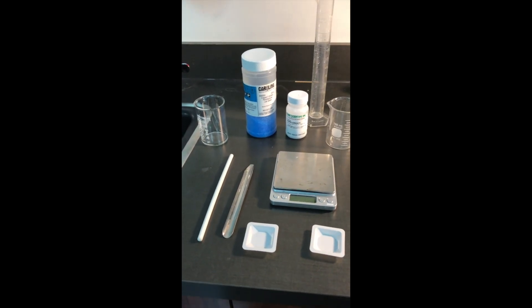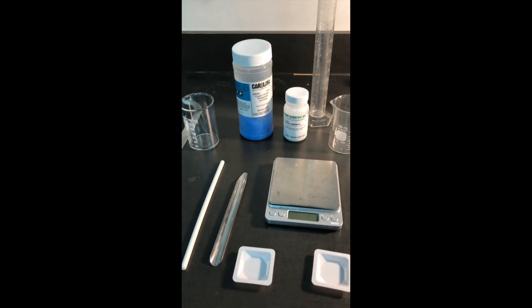Welcome back to Ms. Love's Science Channel. Today I'm going to show you how to do a stoichiometry experiment.